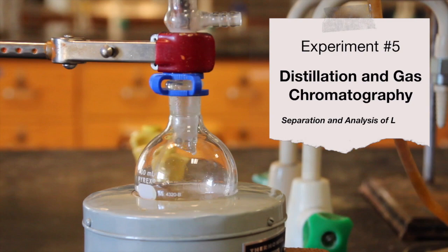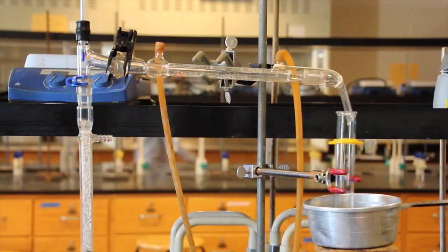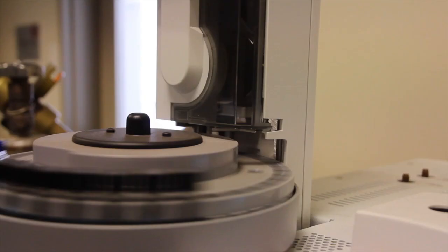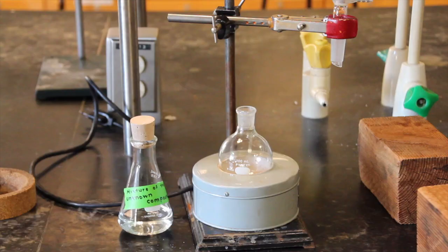In this lab, a mixture of two unknown compounds will be subjected to both simple and fractional distillation with the goal of separating the two compounds and learning about distillation techniques. The purity of separated materials will be analyzed using gas chromatography.